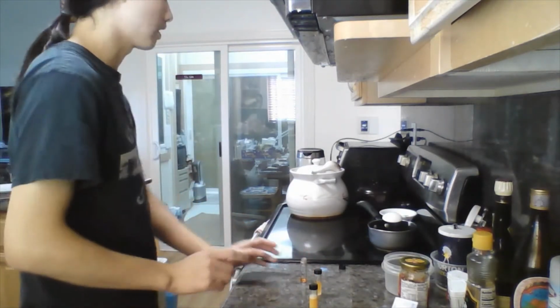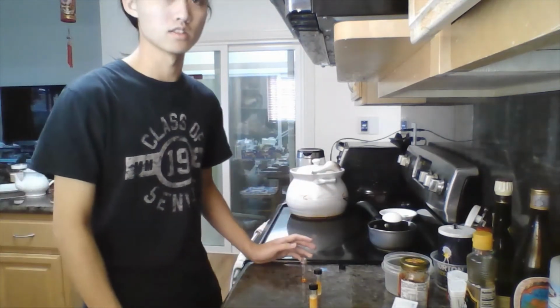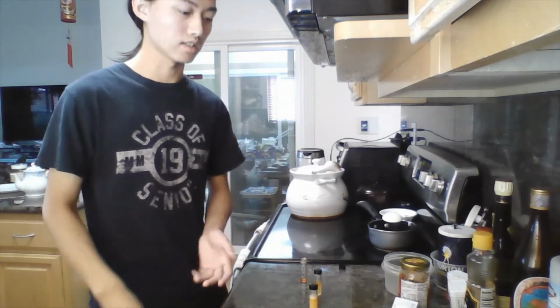I'll now be setting up a hot water bath to heat both of these reactions. I'll let that run for around an hour or so, then I'll be taste testing my results.